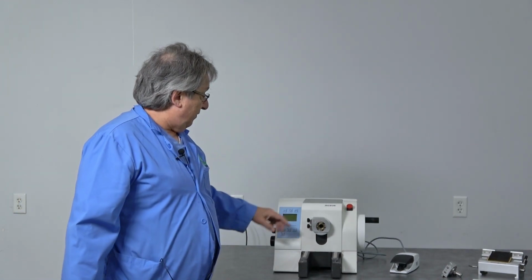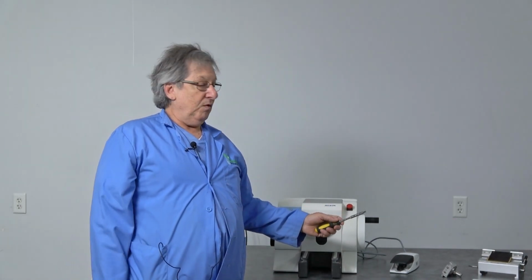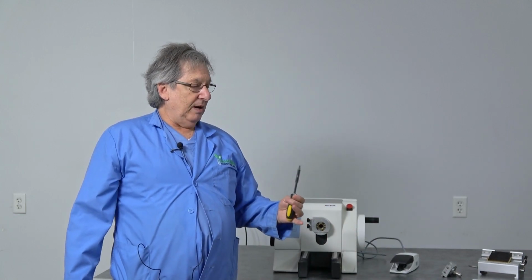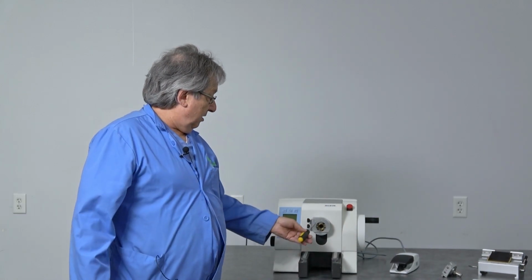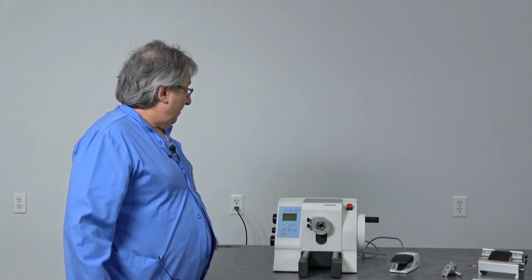This one we've unseized, but every couple days if you leave it set, we left it over the Christmas break, we had to go in with a little tool to the front, get the shaft just turning a little bit, then it'll work fine.